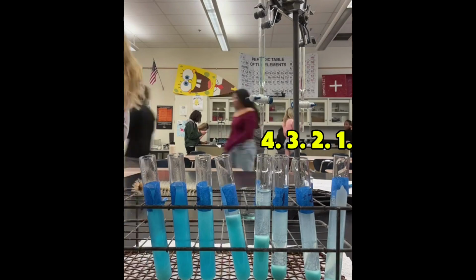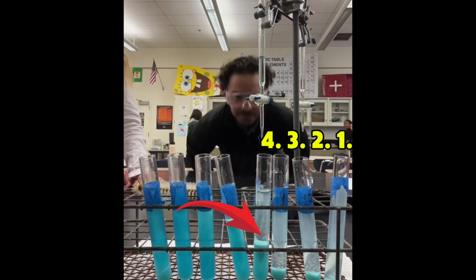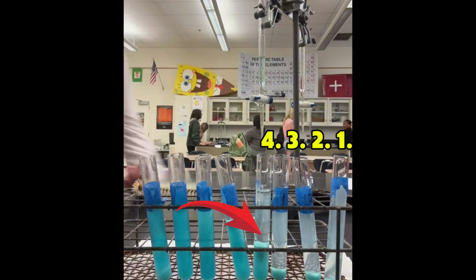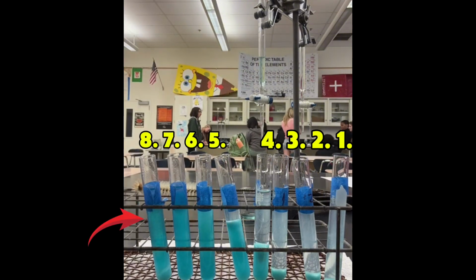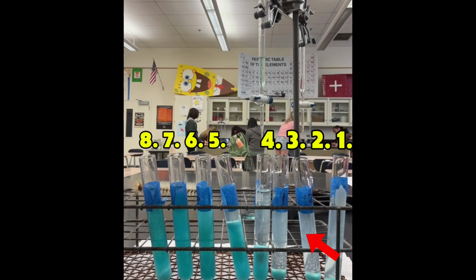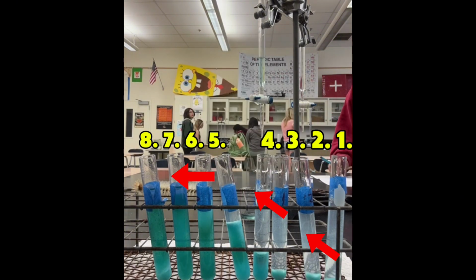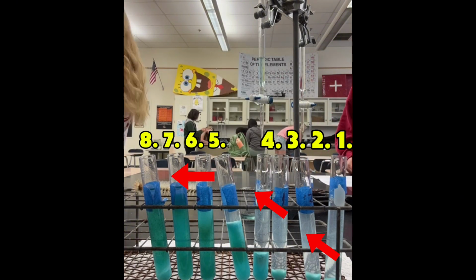During the 15 minutes, test tubes 1 through 4 began to form a bright blue, powdery solid at the bottom of the tube. This was the copper hydroxide with a clear liquid above, being the potassium sulfate. In test tubes 5 through 8, the blue liquid became a darker green, but no solid was forming. Then, we measured the precipitate. There was a gradual rise of precipitate from test tubes 1 through 4, from 4 to 28 millimeters, and then there was a leveling off from the test tubes 5 through 8, going from 60 to 85 millimeters. As we let them sit even longer than 15 minutes, each test tube's powdery solid turned into a black color.